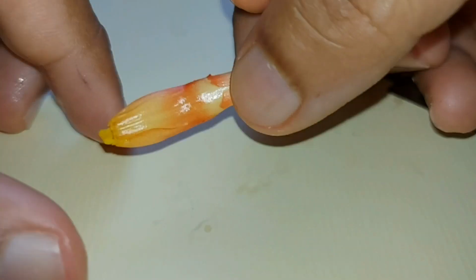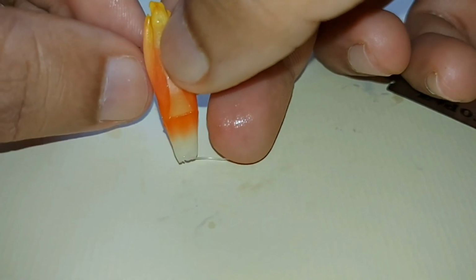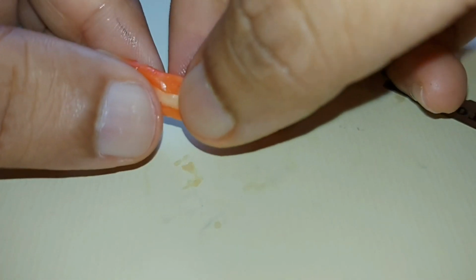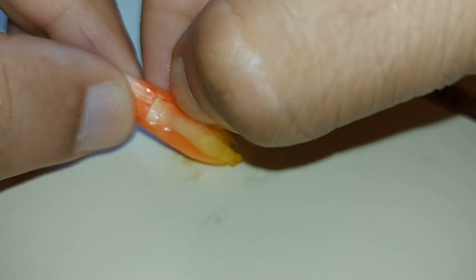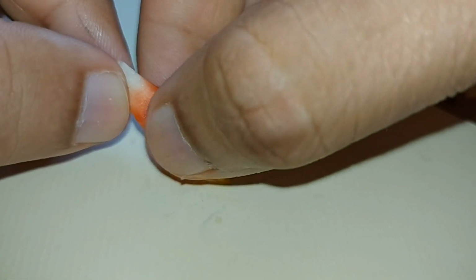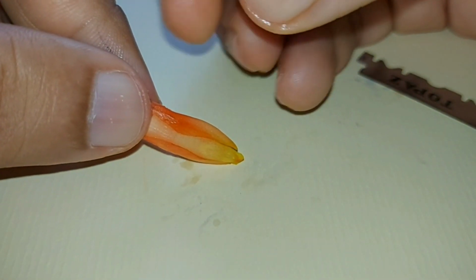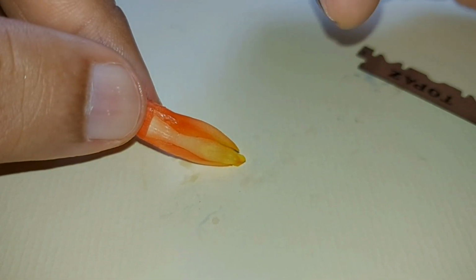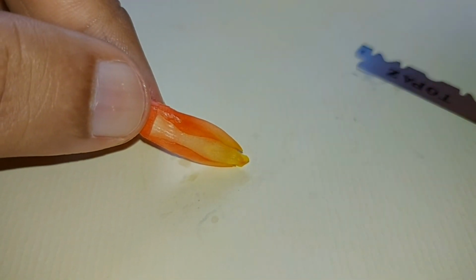Okay, I've peeled back some of the matured petals. As you can see, the petals are actually quite fleshy here. If you look at the tonicity, this is very turgid because the flower was just watered, so the cells are filled with water. The plant cells inside will have vacuoles, and these vacuoles are filled with water and push outwards. So when you push it outwards, the plant will look very, very fresh.